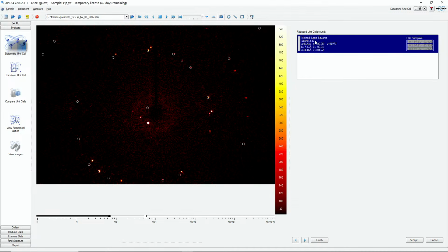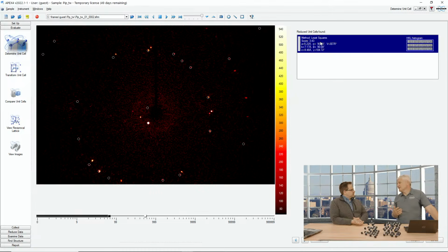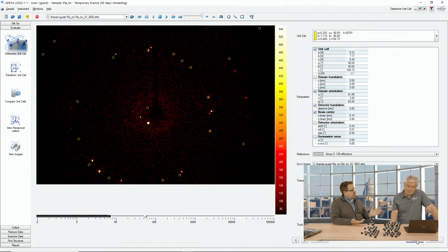So this was basically a black box indexing. It's a little boring to show because it just works. It works, and sometimes that's good, as long as you have the right assumption, right? Yep, with those boundaries. And this is why I always tell people to look at reciprocal space, because humans are very good at picking up patterns. We had seen the zigzag patterns.